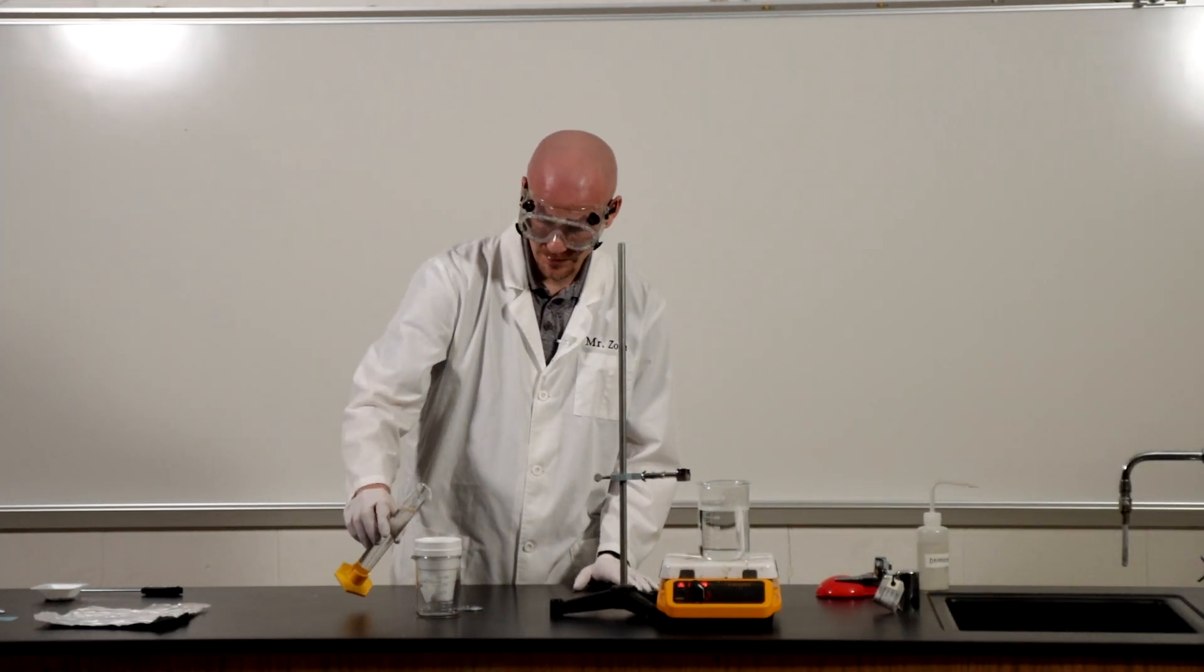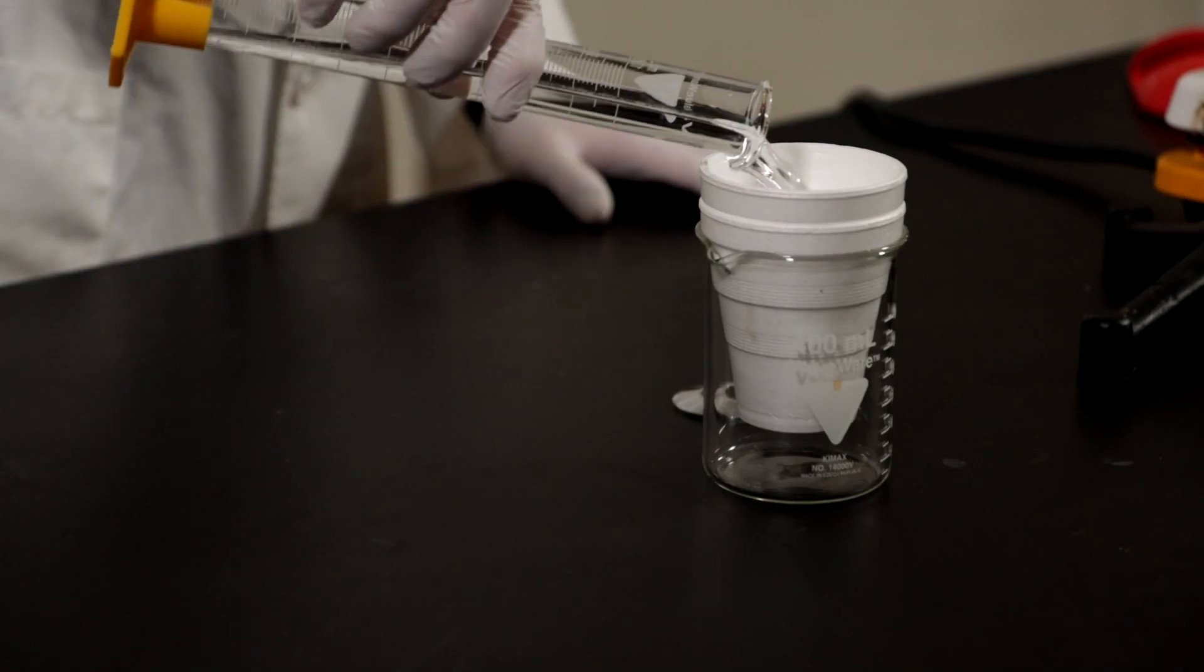So while this is heating, I'm going to go ahead and put my 100 milliliters of distilled water in my calorimeter.